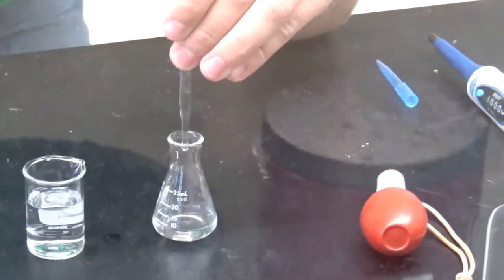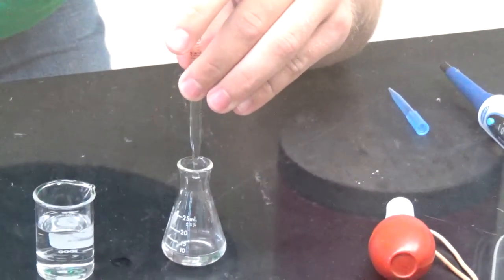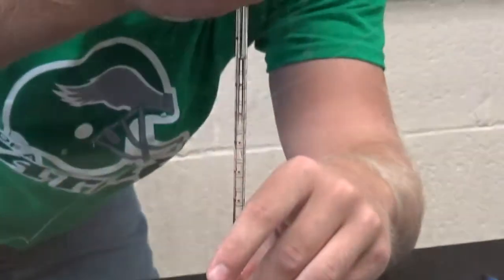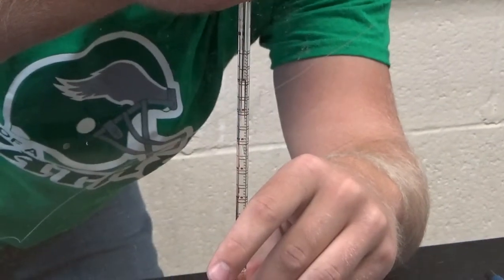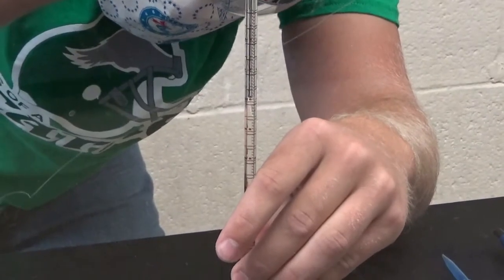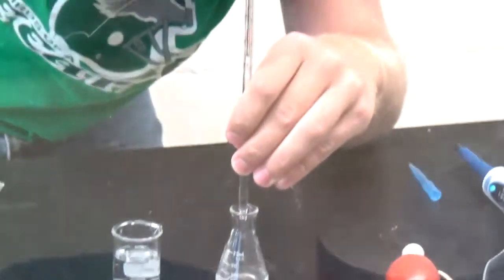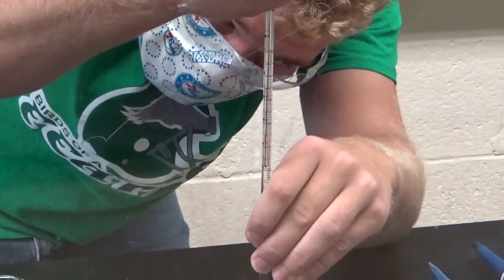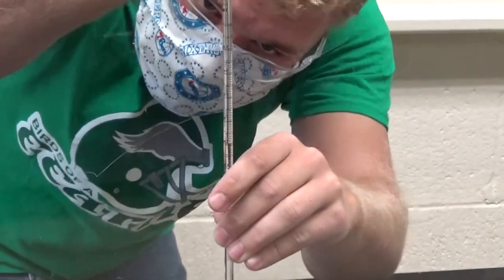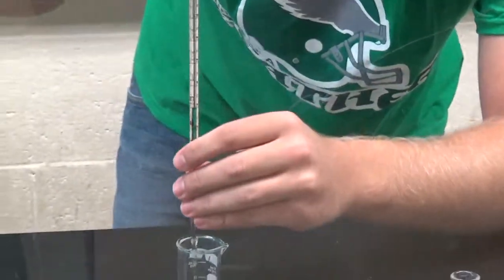You want to transfer the amount all the way to the line. You want to stop on the line that you're trying to transfer. I'm going to try and transfer 0.5 milliliters here. He's not going to drain the whole thing. This is fine. The other way you could do it is just fill up to where you want. While he's doing that, this takes a while to drain. These really small pipettes, there's a lot of molecular interaction between the water and the glass, a lot of hydrogen bonding, which we'll talk about in the course.